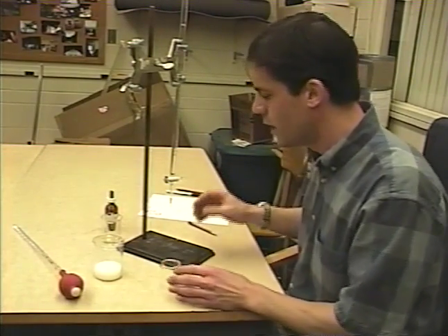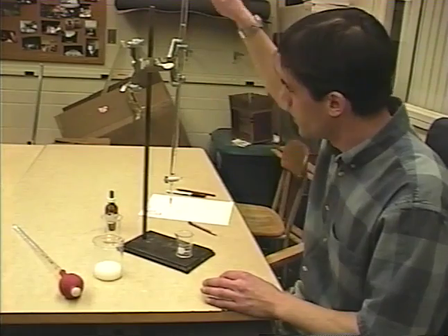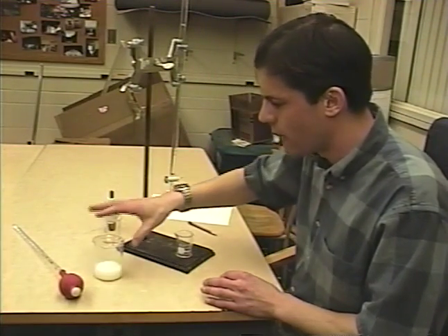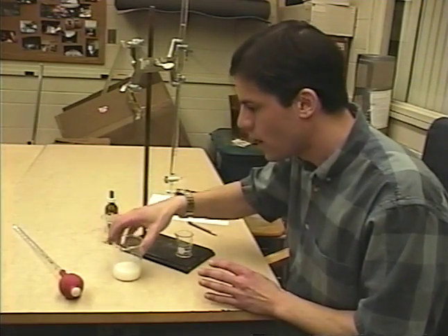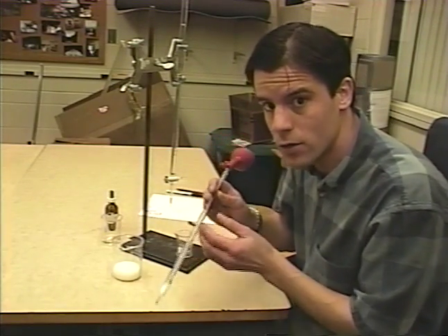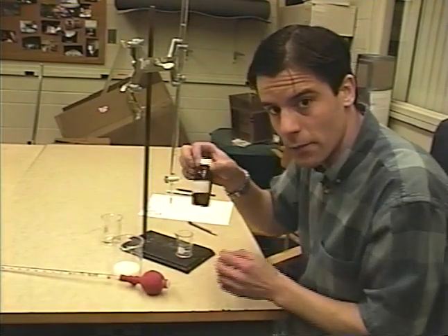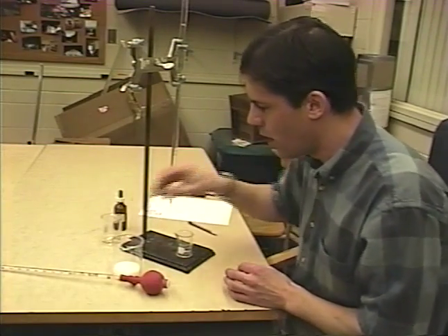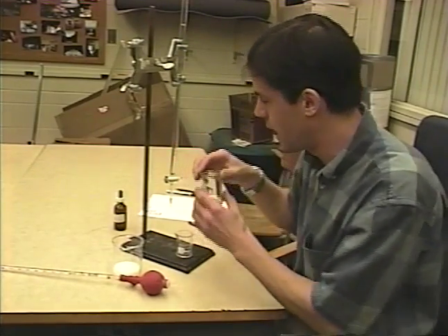The equipment that you should have is some sort of reaction beaker or flask. You should have a burette set up on a burette stand with a burette clamp. The burette is this long glass thing, and you should have a sample or supply of your solution that you're going to be titrating. A pipette, which will enable you to accurately measure out your solution. A pipette bulb. You want some phenolphthalein because that's your indicator, and also a small supply of the base solution that is in the burette.